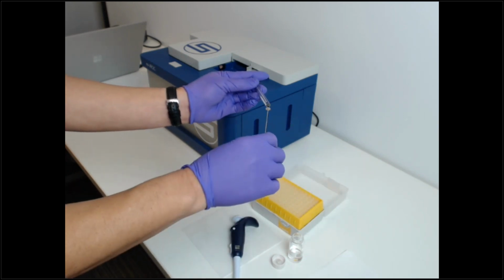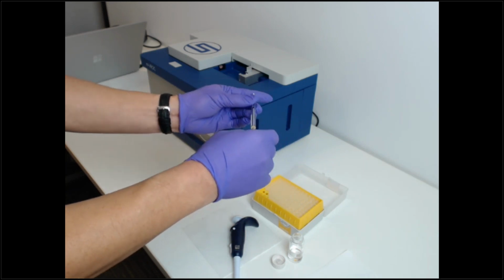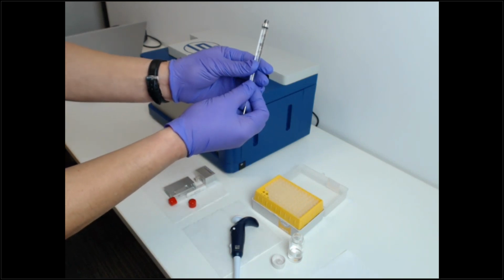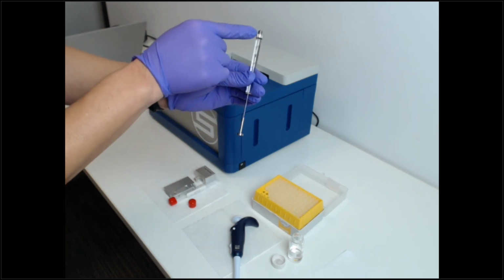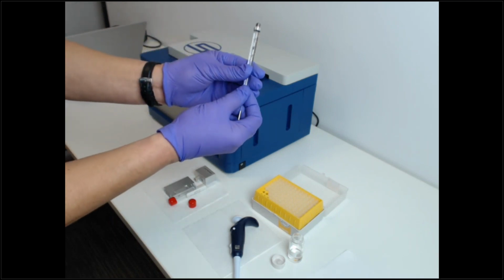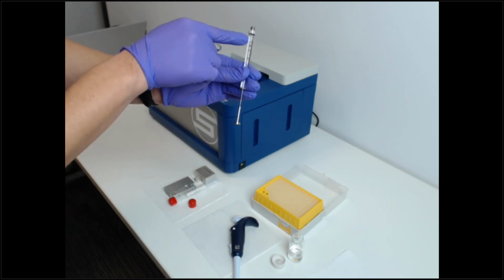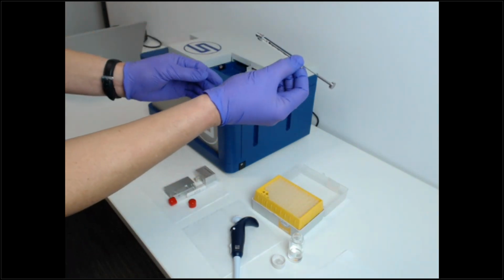And we carefully put the plunger in. And so now you can see the 15 microliters. We developed this technique where we actually don't push the entire contents all the way up, because this hub is actually greater than 15 microliters, so your sample will actually disappear. So we developed a technique where you push the air bubble to the tip of the 30 microliter mark. And so from here, we can do our test.